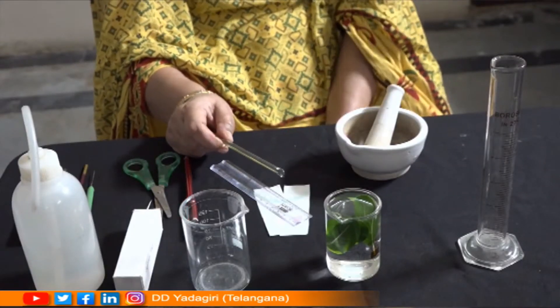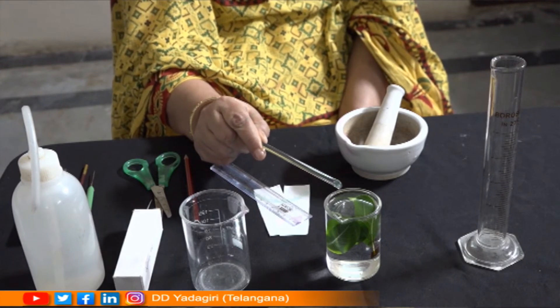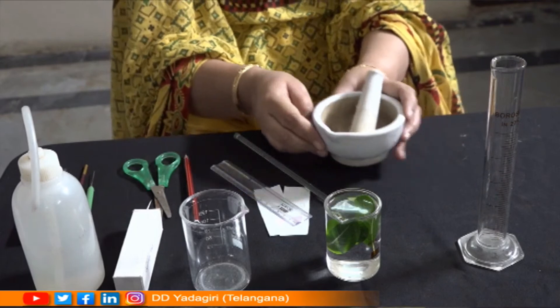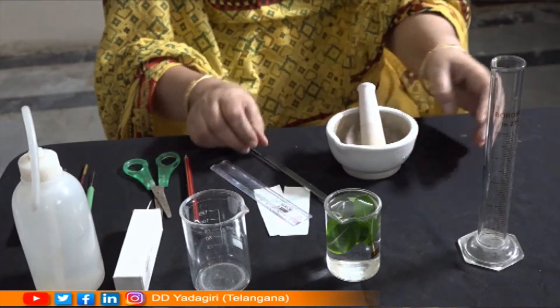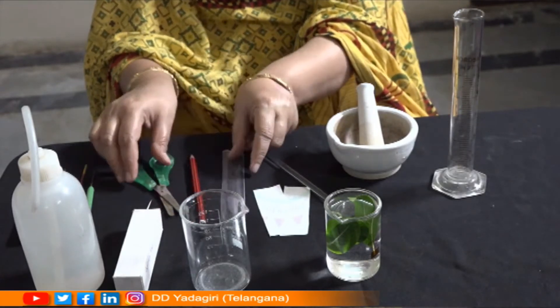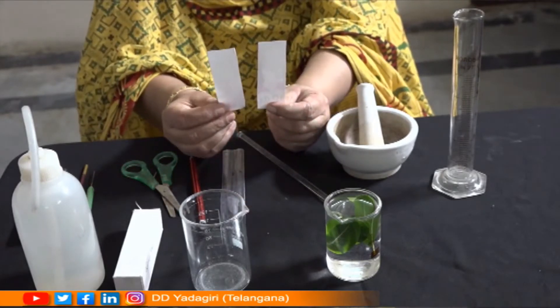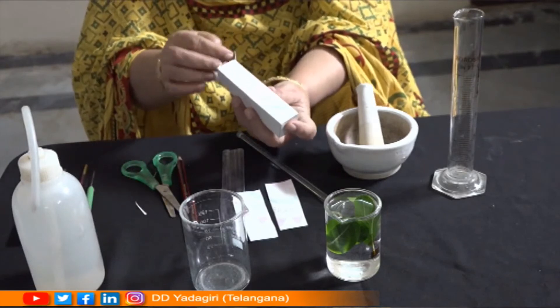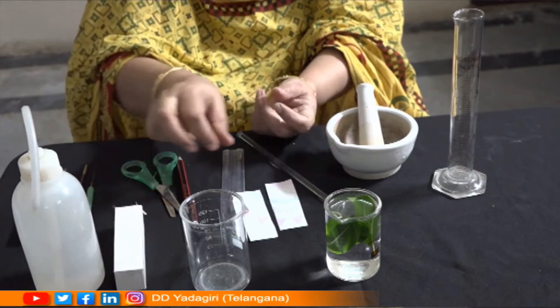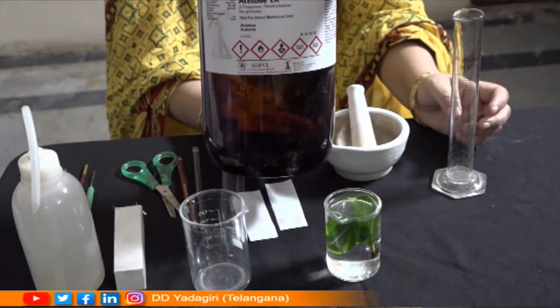To do the separation of plant pigments through paper chromatography, you need: leaves of plants such as spinach, hibiscus, or Tecoma; a mortar and pestle to grind the leaves; a measuring cylinder; scissors; Whatman number one chromatography paper; capillary tubes; and chemicals such as acetone and petroleum ether for grinding and preparing the solvent.